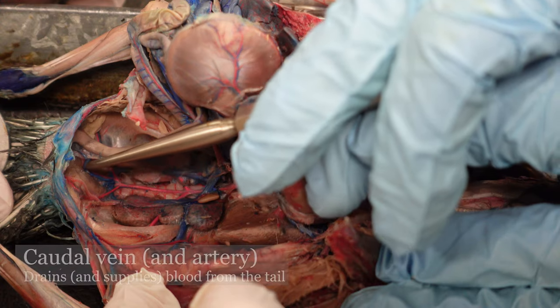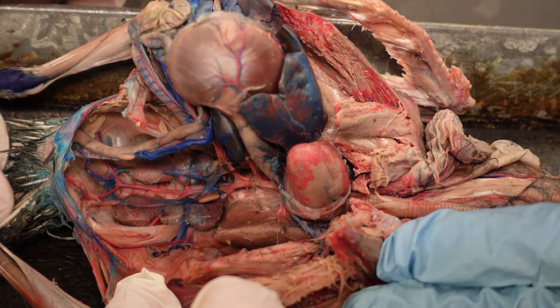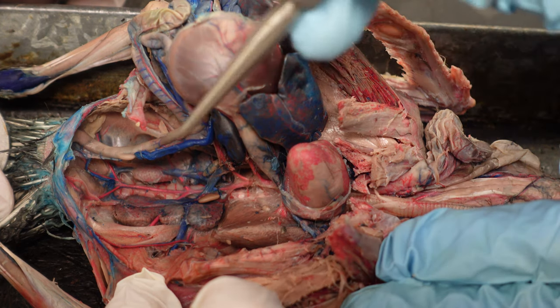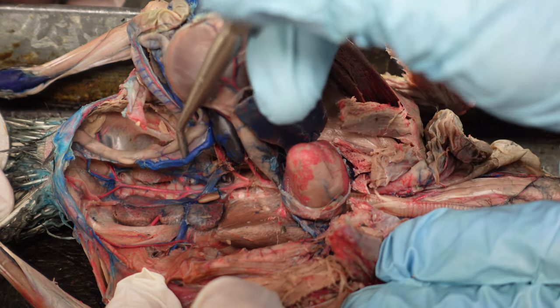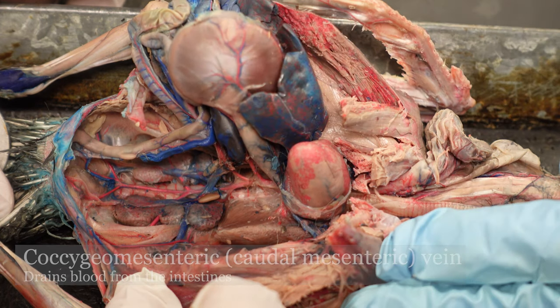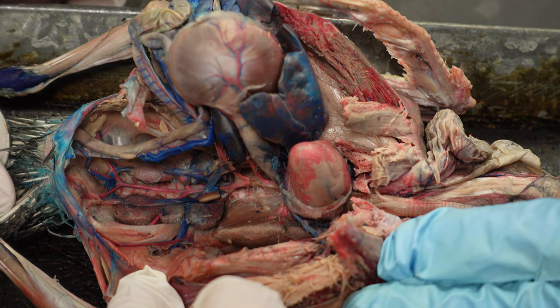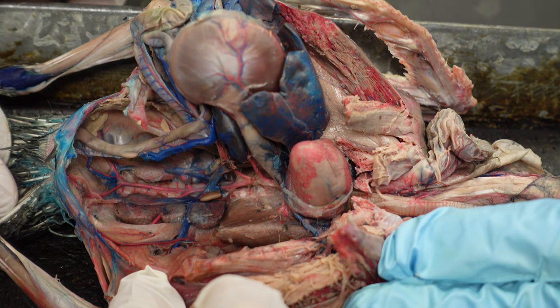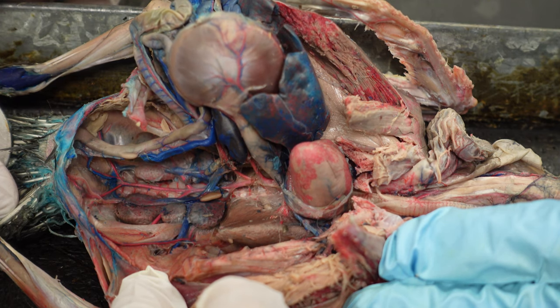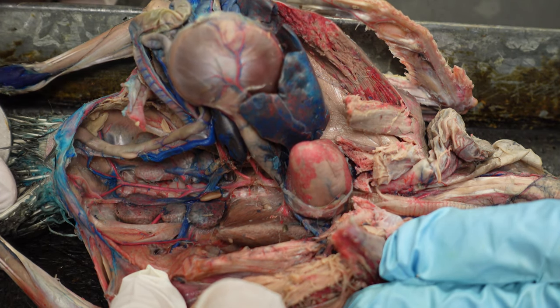Off the iliac branching, this is the caudal vein alongside that caudal artery. And last but most certainly not least, we have the coccygeo-mesenteric vein — look at that, in all of its glory. Also called the caudal mesenteric vein. But the other term is much better; it just sounds cooler, so use that one. Either one's fine though — they're both acceptable.